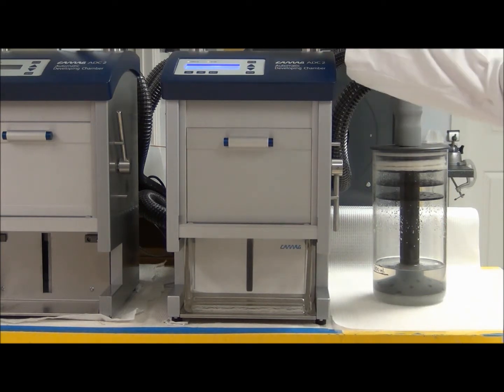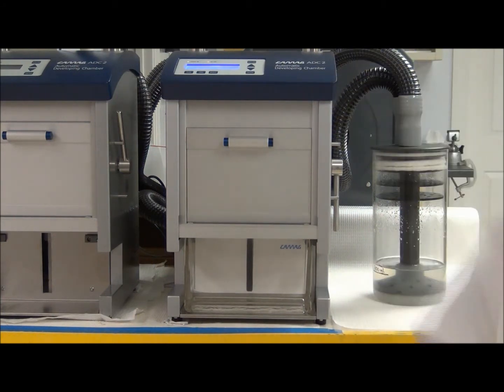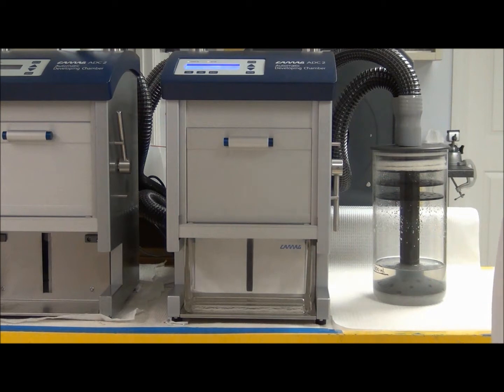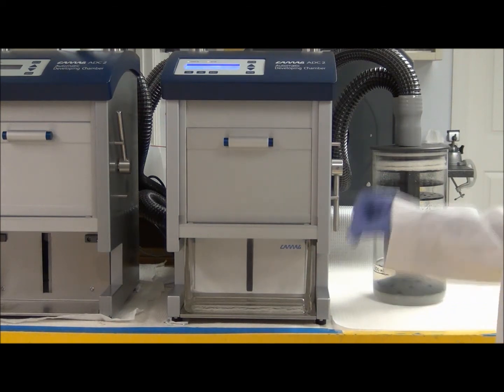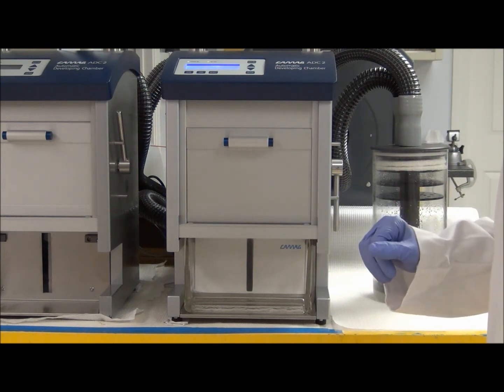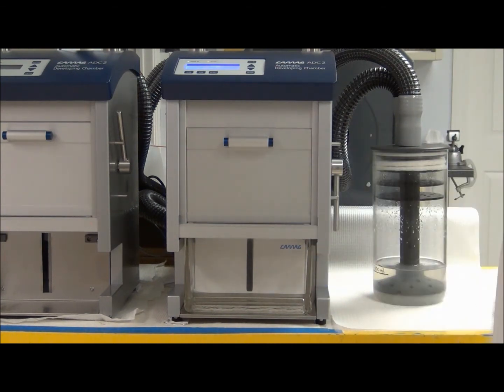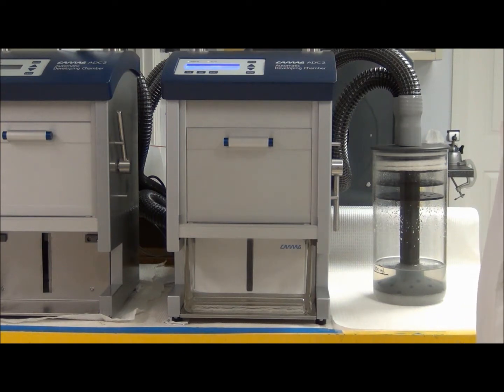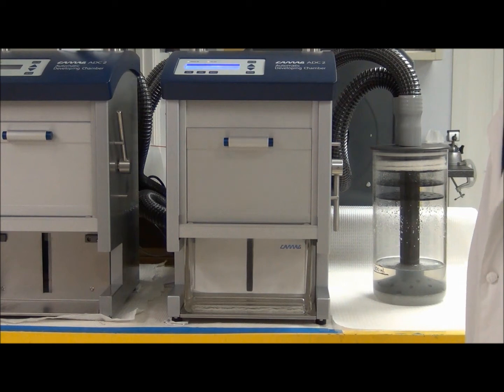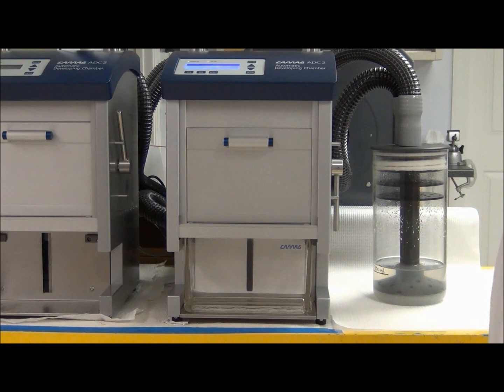There's a connection on the back of the ADC2 that is being sent out to our fume hood to an exhaust, and as you can hear there's a blower inside that forces that air out, so it has pretty good airflow exiting the instrument. You would just connect that to an exhaust system to draw out the solvent fumes. This will continue for about another four and a half minutes, and then the development will be finished and we can remove the plate.